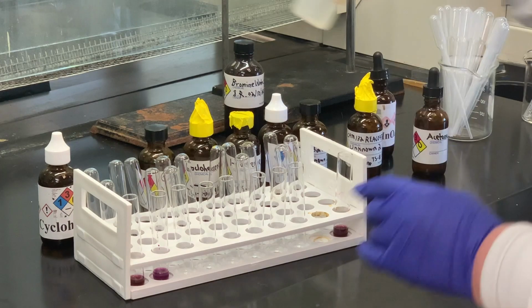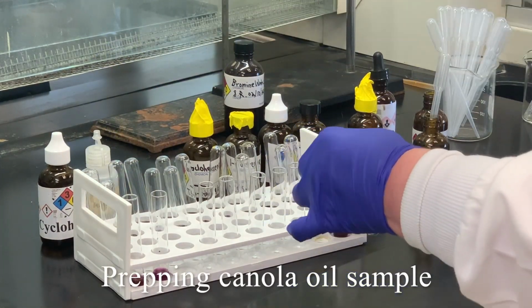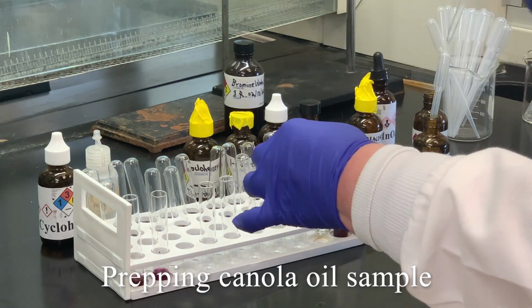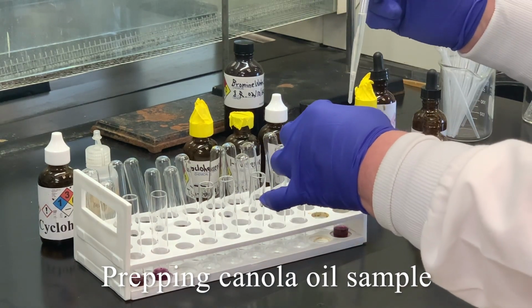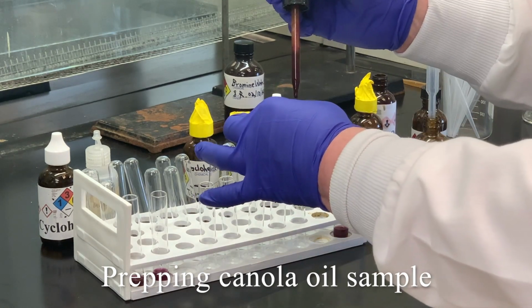Third sample we're going to try is the canola oil. Add some acetone to the test tube, a few drops of our sample, and then a drop of the potassium permanganate.